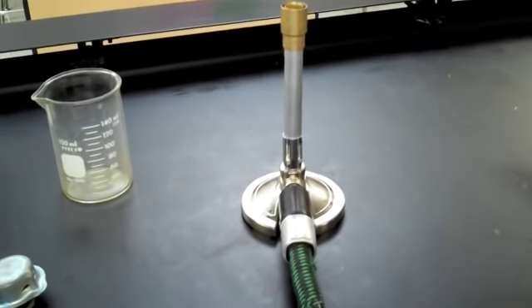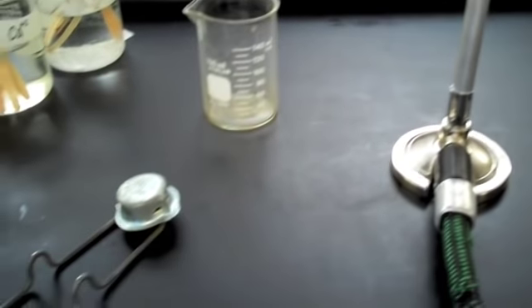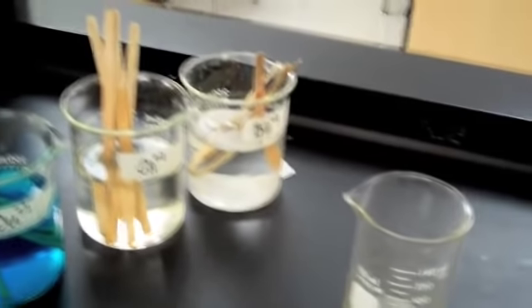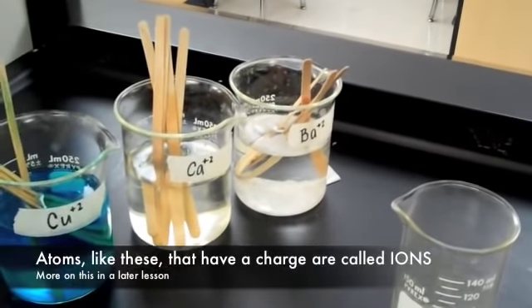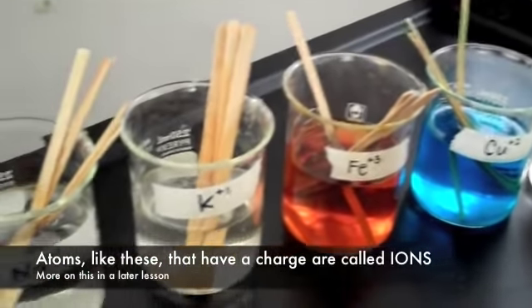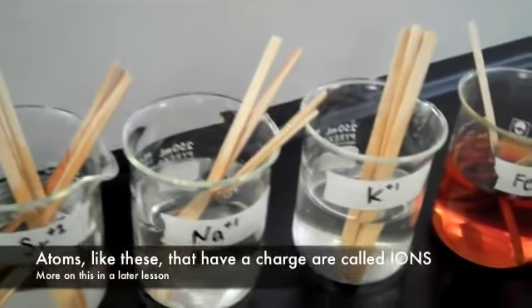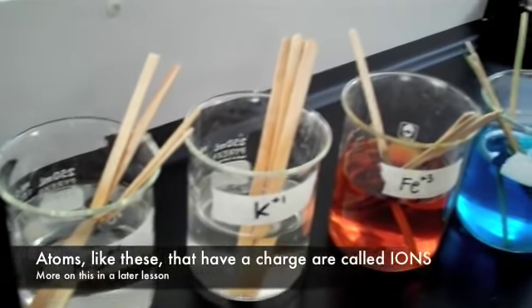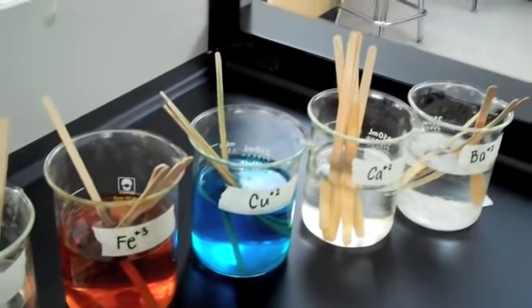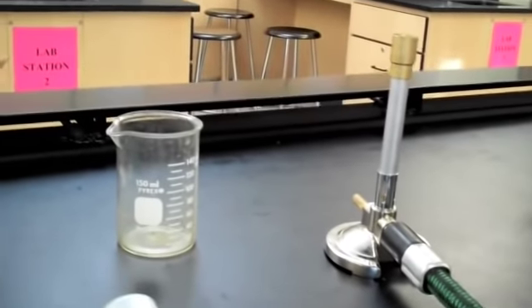For this experiment, you will need your Bunsen burner, an empty beaker, a striker, and samples of the following atoms: barium, calcium, copper, iron, potassium, sodium, and strontium. As you can see, there are wooden splints in each of these samples that we will be using for testing purposes today. For the safety of this lab, please be sure to wear goggles at all times.